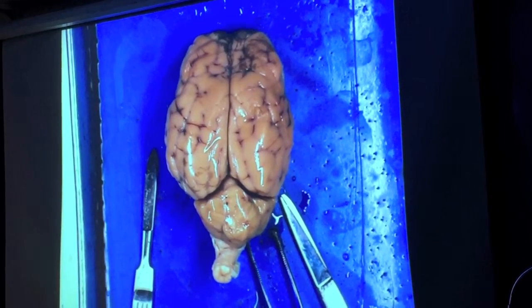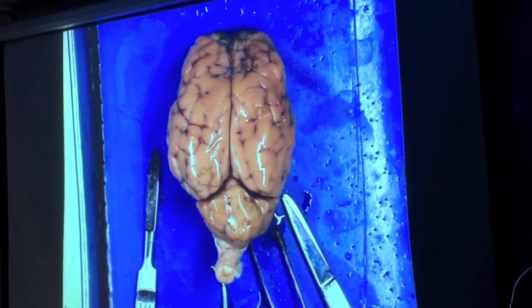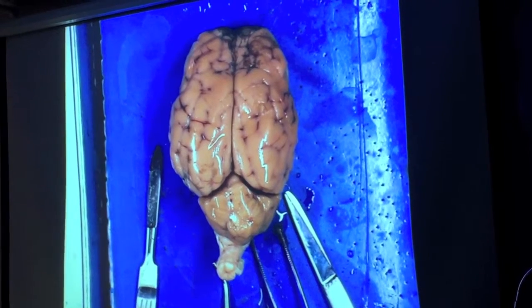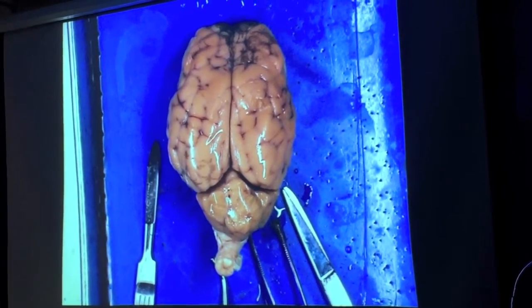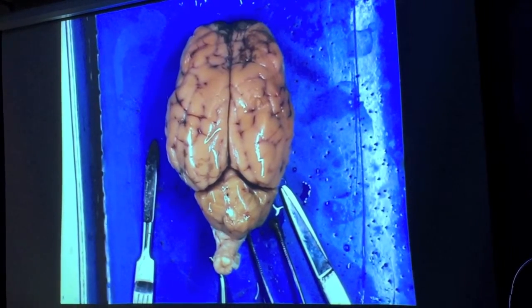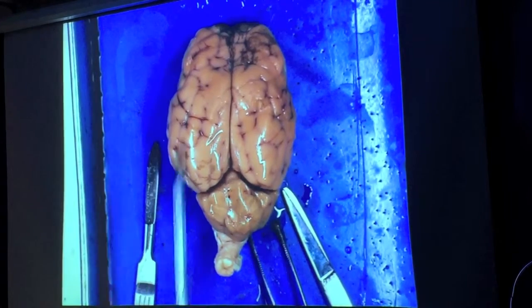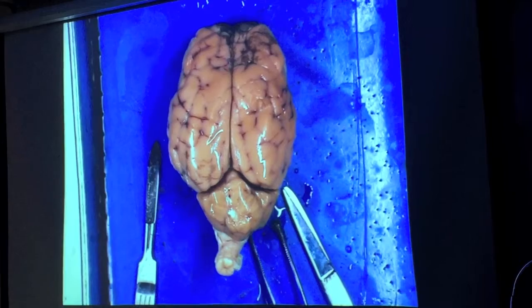The structure of the brain, to help pack it into a smaller space, you take advantage of the fact that you can sort of fold it up. The surface area to volume ratio type stuff that we've talked about a little bit in other topics in lecture comes in here. The folds and grooves on the brain produce this pattern, which is a lot more distinct on a human brain, but you can still see a little bit of that on the sheep brain.